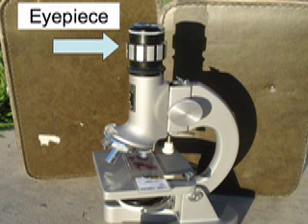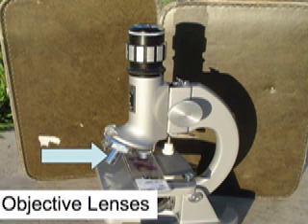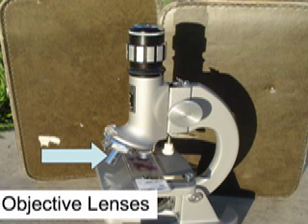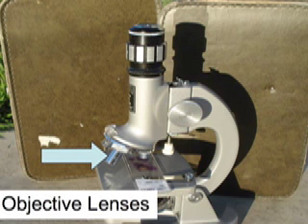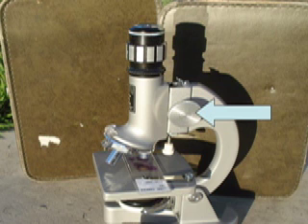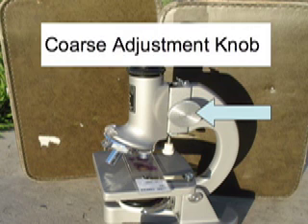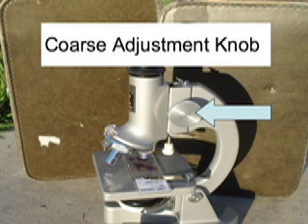This is the objective lens. There are many objective lenses on the microscope; they range in magnifications from 4x to 40x. This is the coarse adjustment knob — we use the coarse adjustment knob to focus on our specimen.